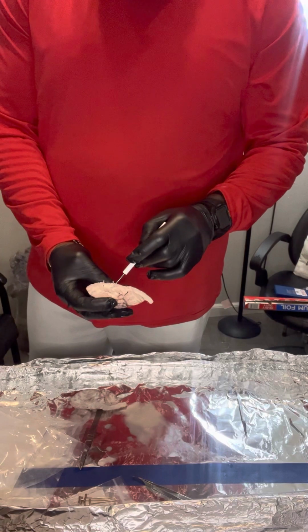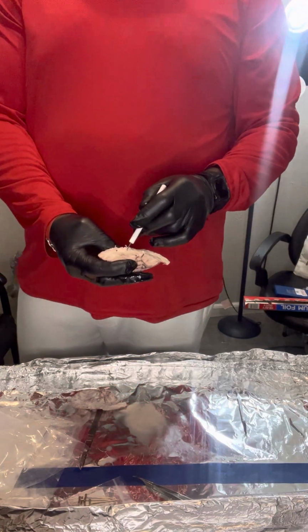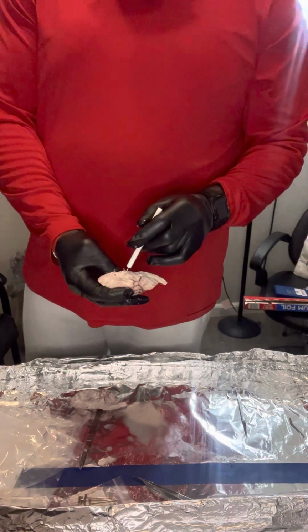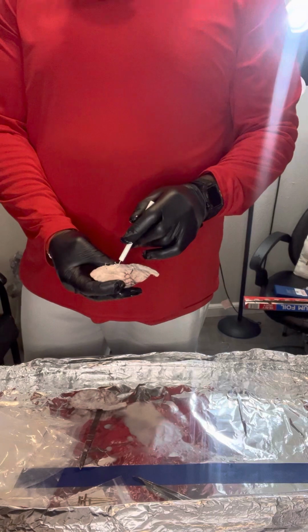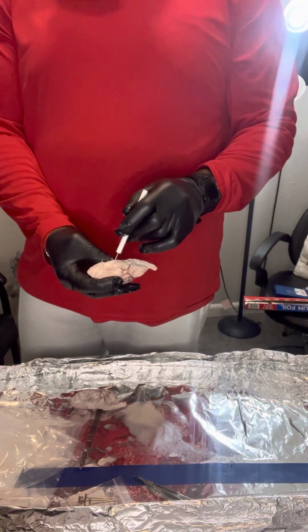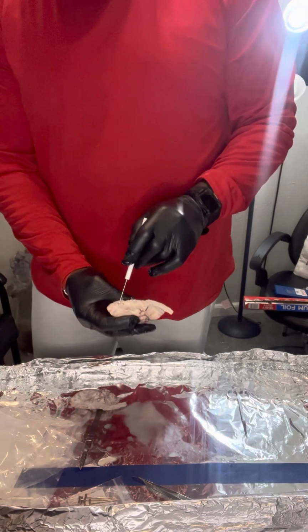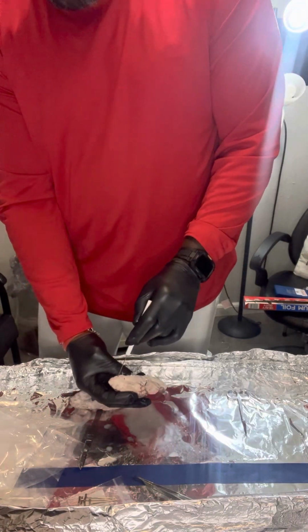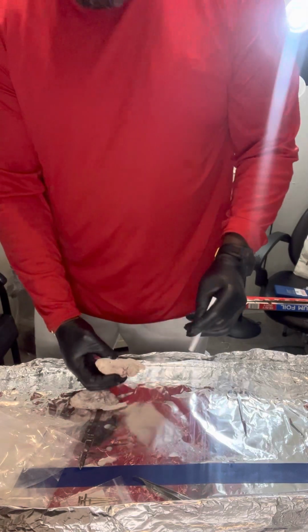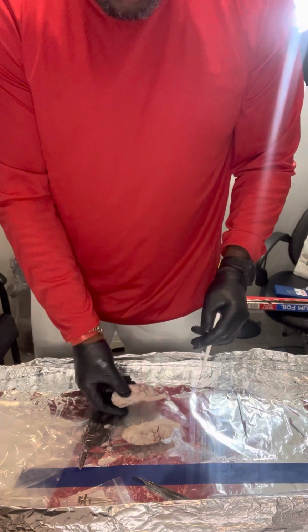The next is the olfactory bulb. The olfactory bulb, that there is what basically receives information about smells from the nose and sends it to the brain. Of course, there's the olfactory tract, which is kind of right in here, by the way. The olfactory bulb kind of right in there. I wonder if you can see it better here instead.